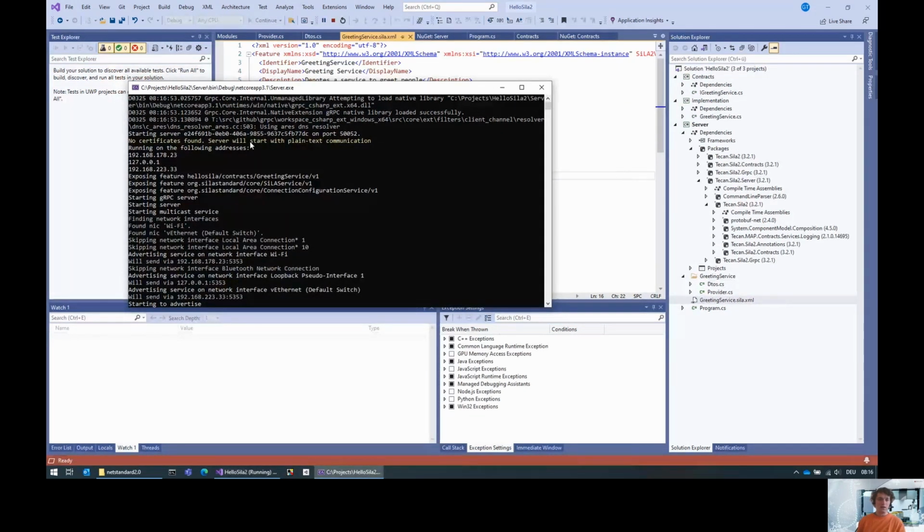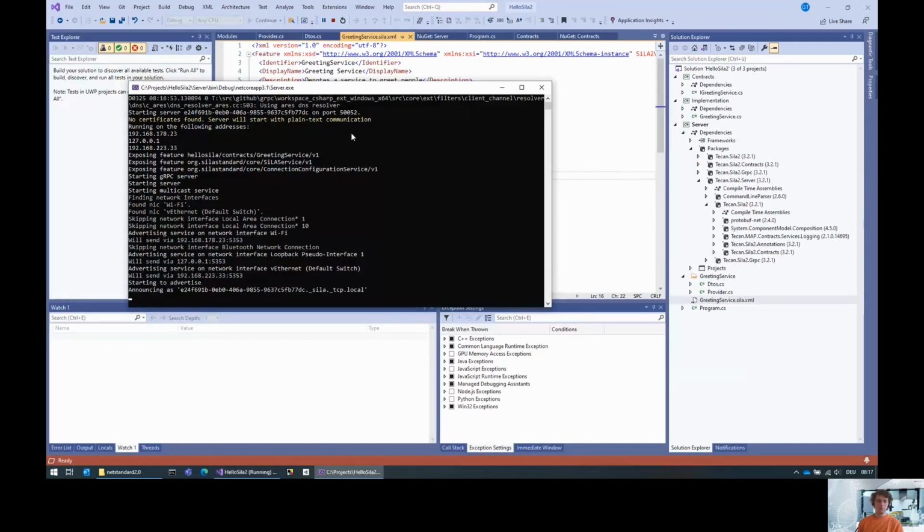So now what is that? By default, the server logs to the console. You can change that if you want to. I will show that in a later video. And here it says that you didn't provide any certificates, and therefore the server will start with plain text communication. That is a warning. So you basically have to provide some certificates, and otherwise the server is not using encryption as defined in the standard. But for the rest of this video, we'll use the plain text communication, and I'll show you in a later video how to add certificates.